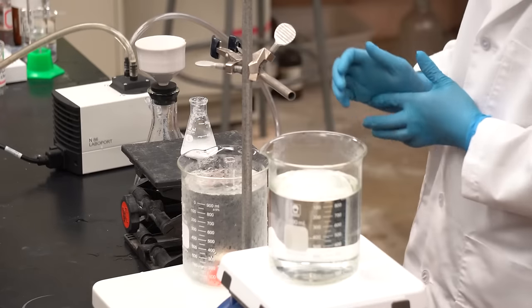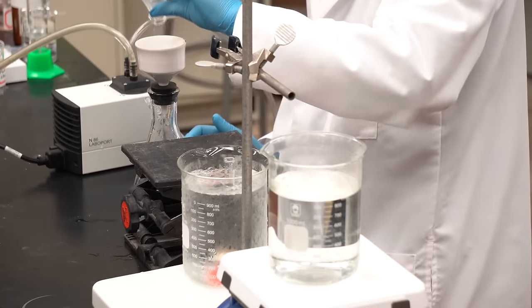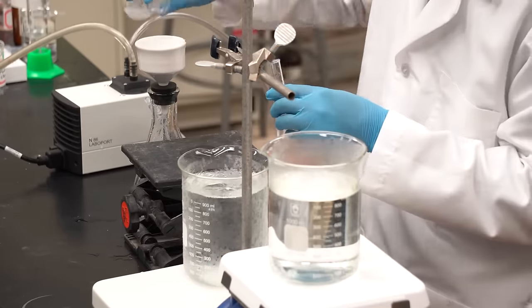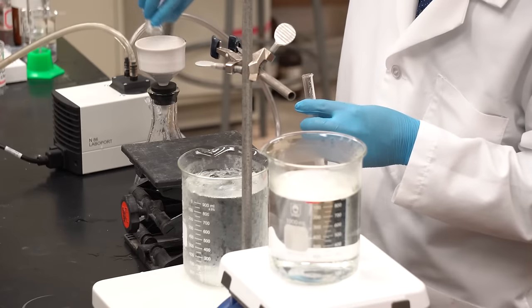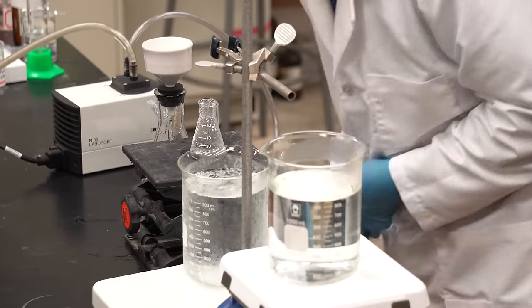After we've formed aspirin crystals, let's collect them by vacuum filtration. Place some filter paper in the Buchner funnel, and then add the solution. Be sure to rinse the flask with cold water to get all of the product out, and also to wash with water to remove impurities. Let's run the vacuum for a few minutes to make sure that everything is dry.